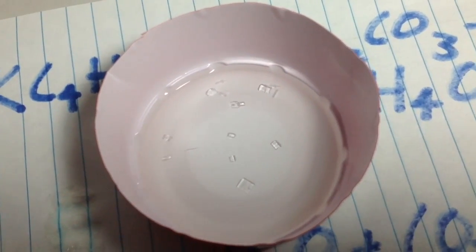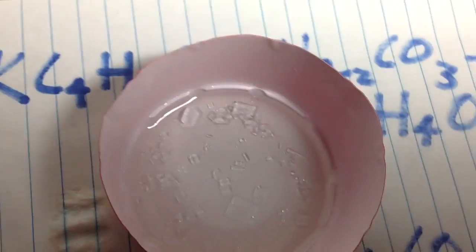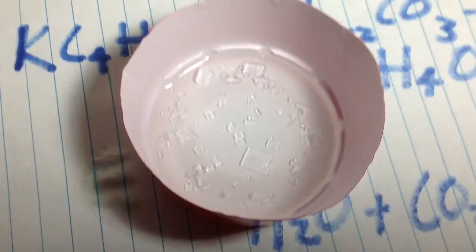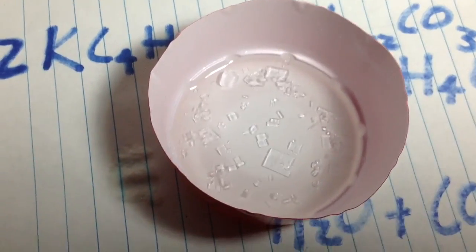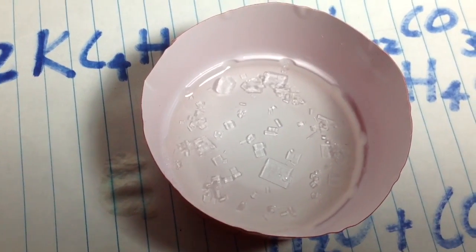That means if we added some starter crystals to the solution all the way at the beginning, we could speed up the process of crystal growth, and I'll be demonstrating that later in the video. So I left the solution to crystallize overnight, and here I am in the morning. As you can see, a lot of new crystals have formed, and the old ones before have grown bigger. It's been a week since I first made this solution, and let's see what we got below.